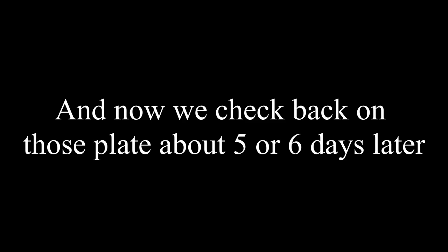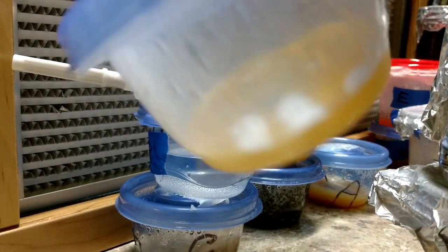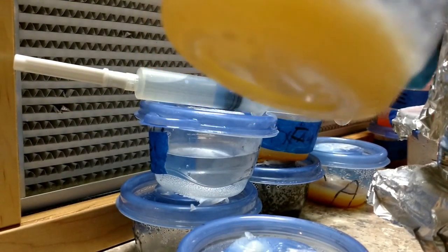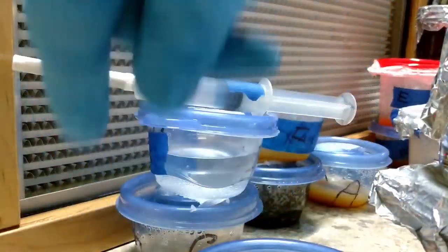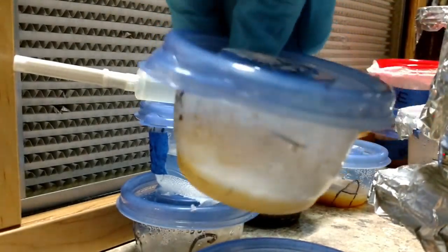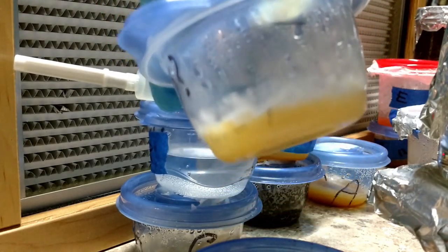Here's our mycelium — this is from the original multi-spore syringe. We've got some nice white mycelium going in there on our homemade PDA broth. That plate is actually pretty well covered, that mycelium looks more aggressive — there's something interesting there. So we're probably going to go with D. A little Darwinism there — only the strong survive. There's another nice one, number five.